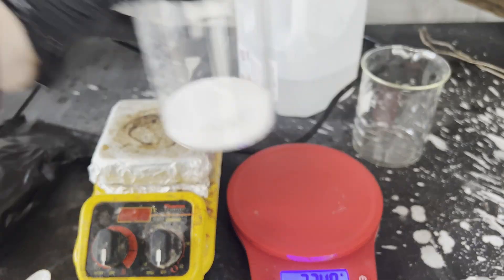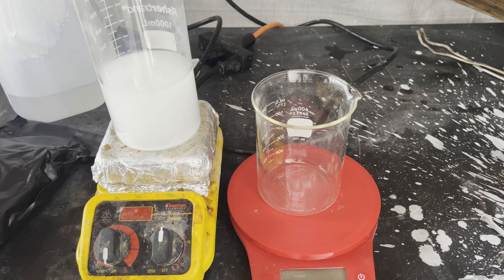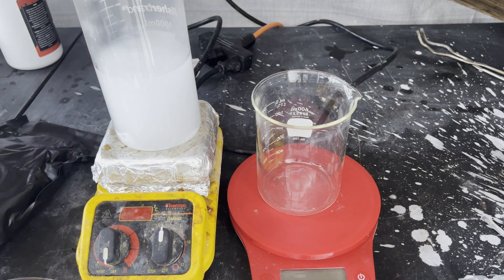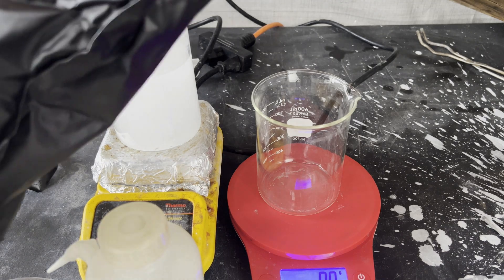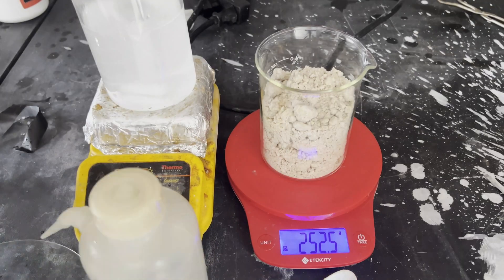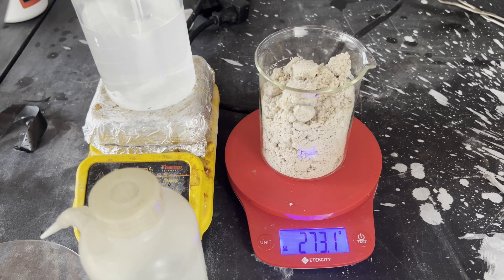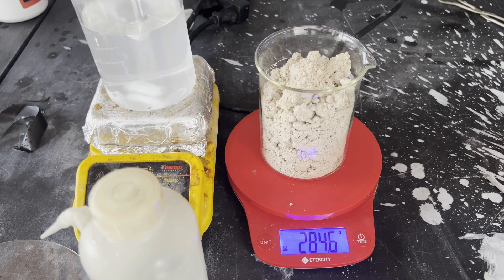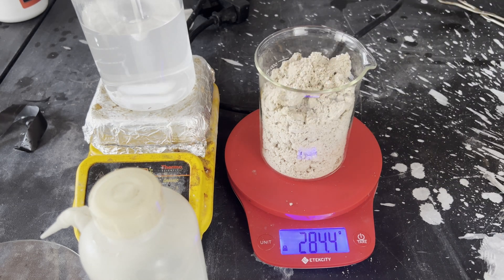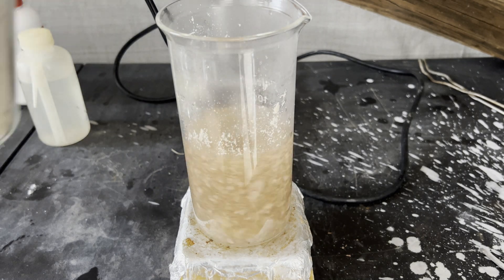The aniline, a liquid at room temperature, separates, forming a second layer on top of the water. It's slightly more dense than pure water, but the dissolved sodium sulfate and hydroxide makes the aqueous layer more dense, so it floats on top. I could separate the two layers and distill the aniline straight up, but I didn't realize how impure the starting aniline sulfate was until I saw how dark the freebase form was. Instead, I decided to filter it to remove any insoluble impurities, then steam distill it.